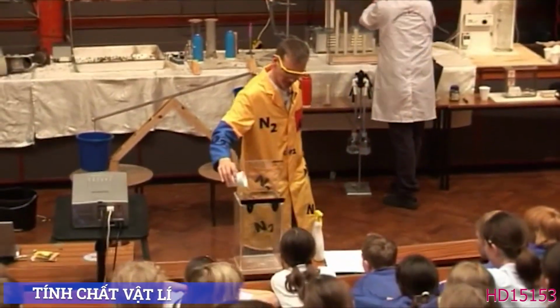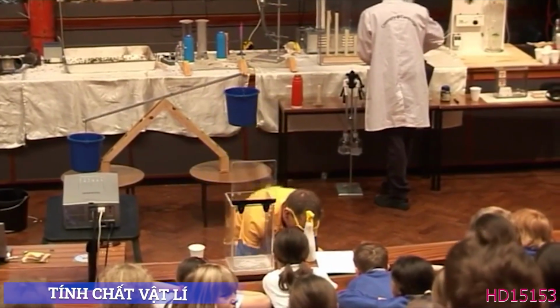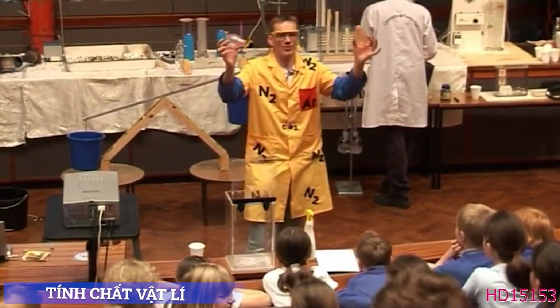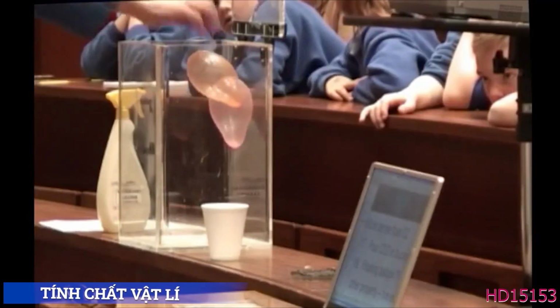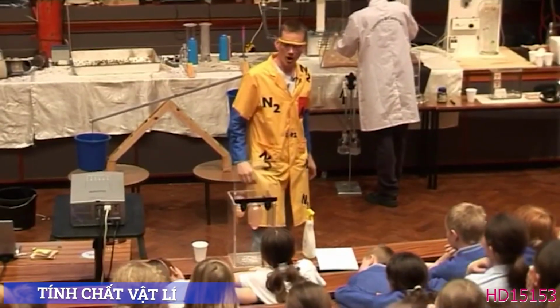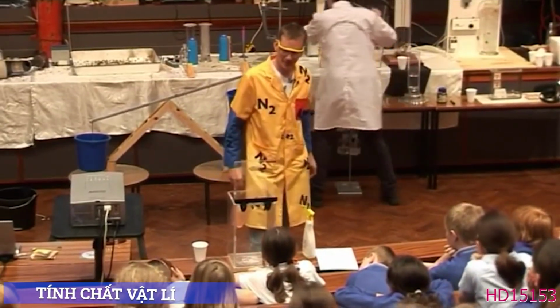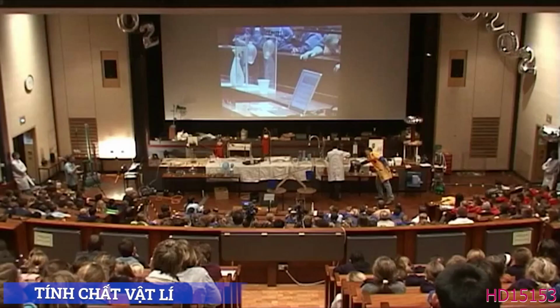So this is going to make some carbon dioxide gas go into the tank, and now I'm going to add 2 balloons. The balloons are just filled up with normal air, but look, they don't go all the way down to the bottom. They're floating in there on top of the carbon dioxide. Okay, and this is because the carbon dioxide is heavier than air.